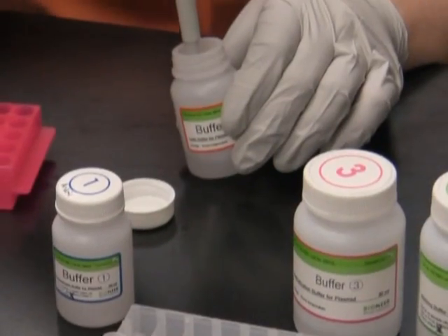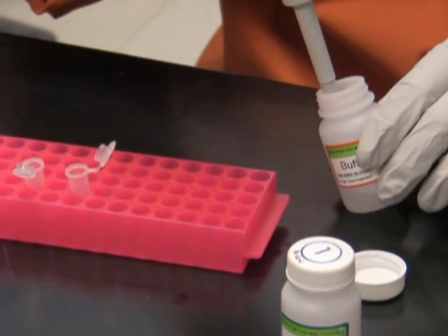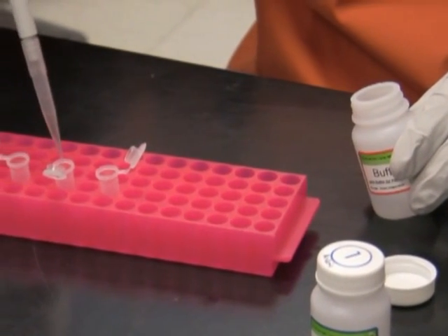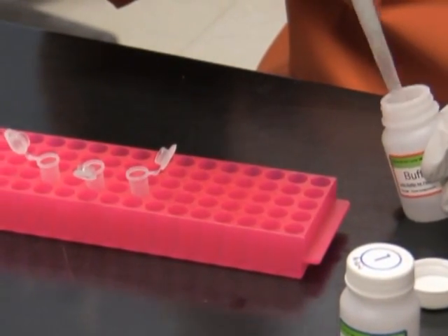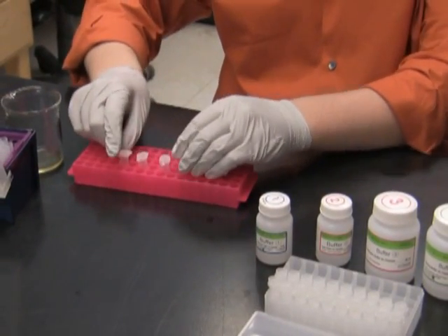Now I'm going to add 250 microliters of lysis buffer and mix the solution by gently flipping over the tubes.